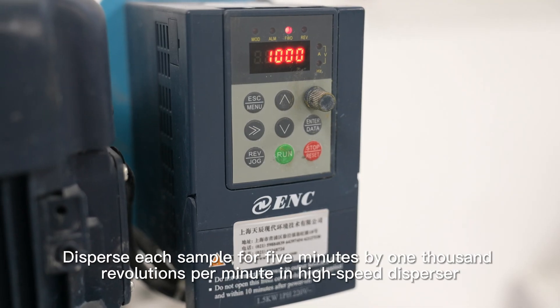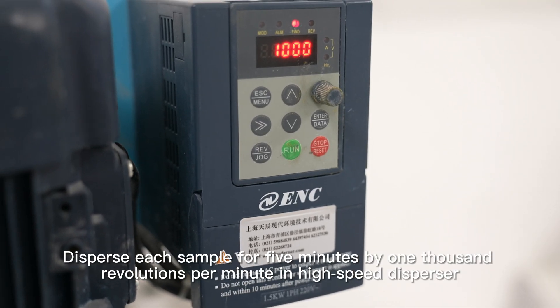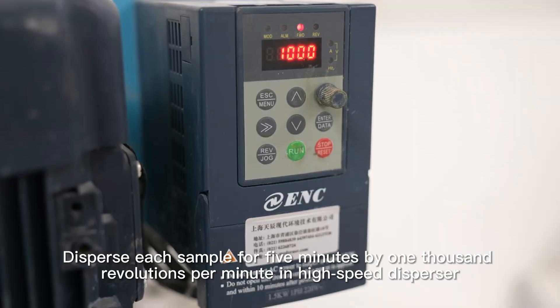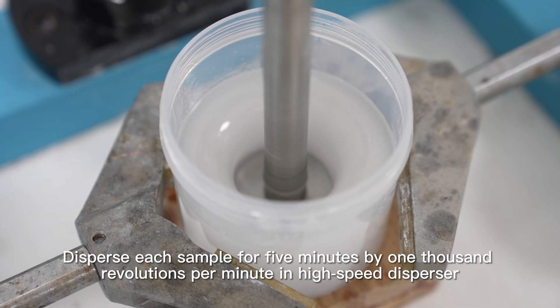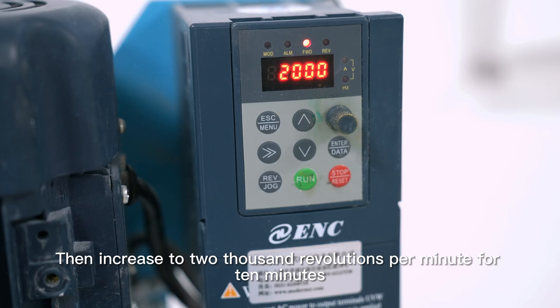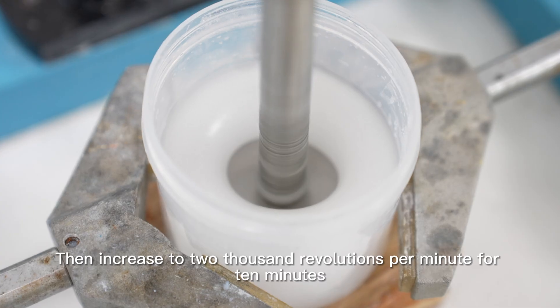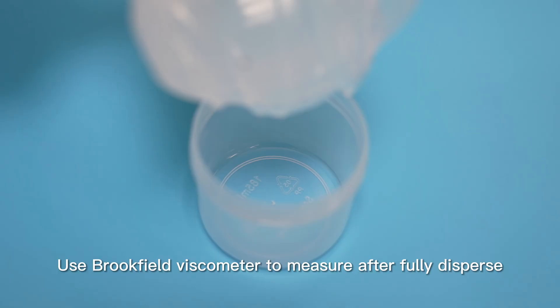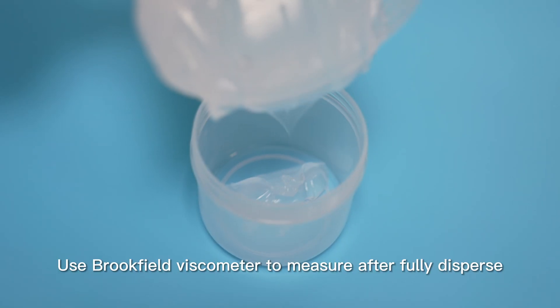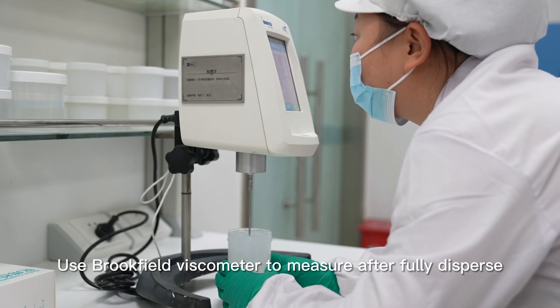Disperse each sample for 5 minutes at 1000 revolutions per minute in a high-speed dispersor, then increase to 2000 revolutions per minute for 10 minutes. Use a Brookfield Viscometer to measure after fully dispersed.